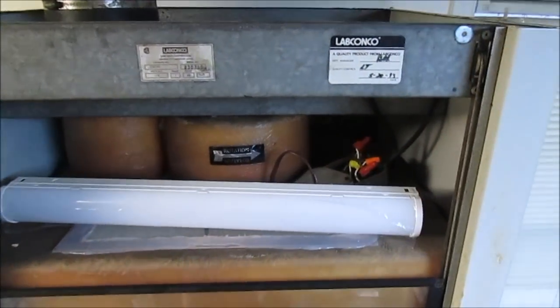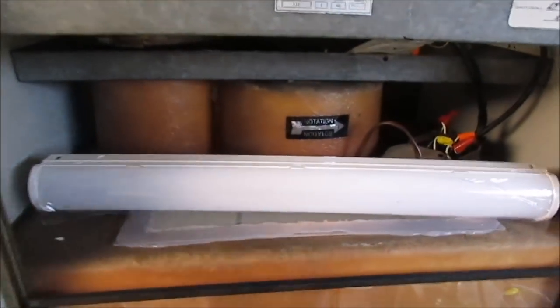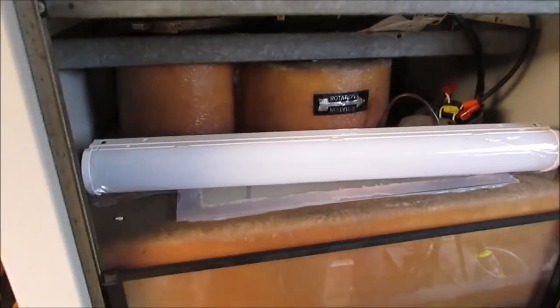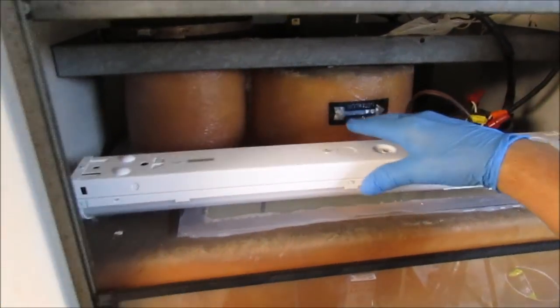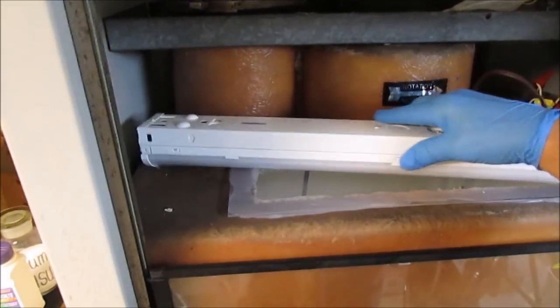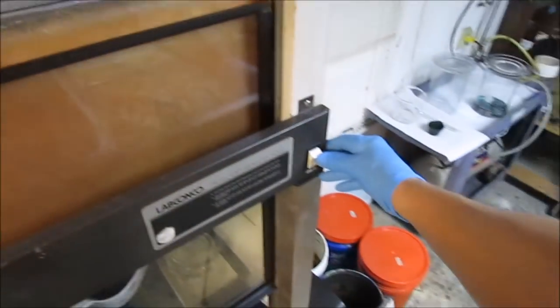All right, this LED strip that I had, I don't know what the lumens was on it, but it was real bright, and it is bright. I have a lot more light inside my Fume hood now. And I just kind of laid it across the top of the hole that I made here with the piece of plexiglass, and like I said, I wired it so that the switch powers the light. It was an easy installation, took less than an hour.